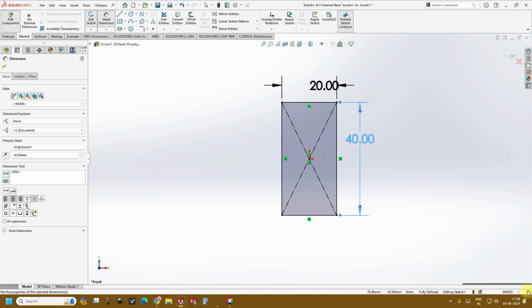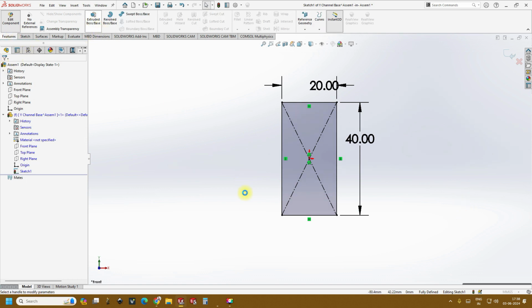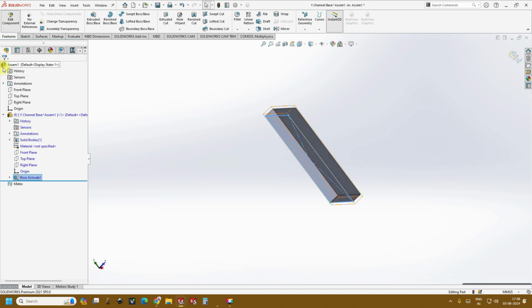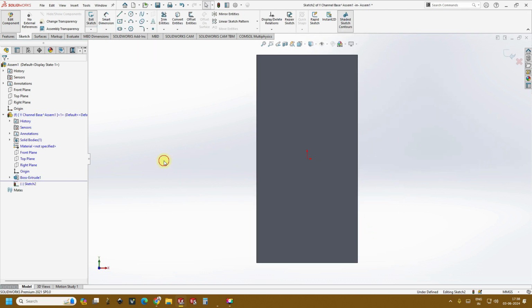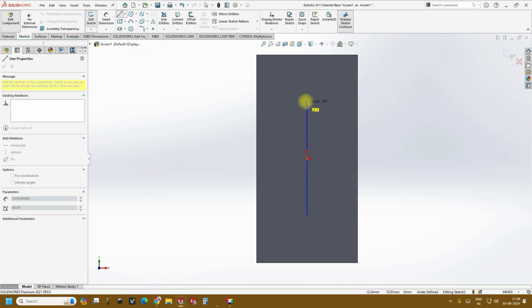So always make sure that your sketch is fully defined, and then go to features, extrude boss, and this base is around 4 mm, and it completely depends on your 3D printing requirements. And once it is done, just select this face and create a sketch on this. So for today we'll be doing the Y channel. So in the Y channel you go to midpoint line. You can do anything you want.